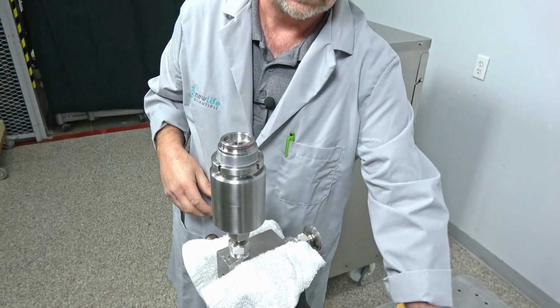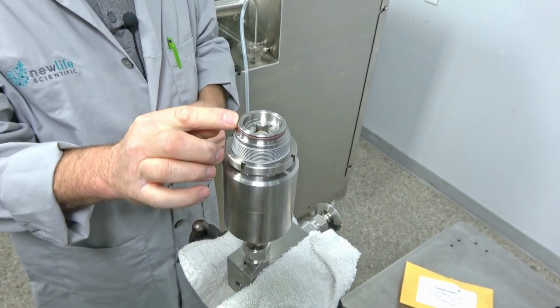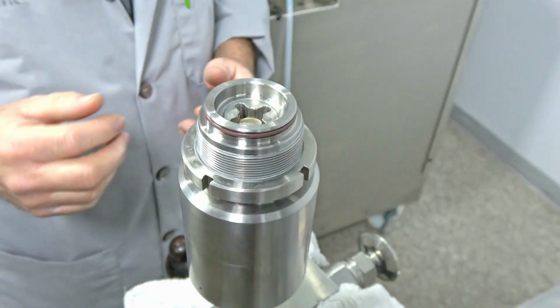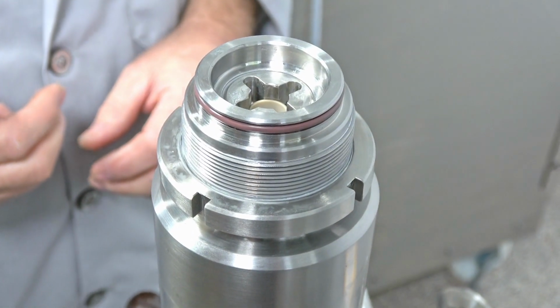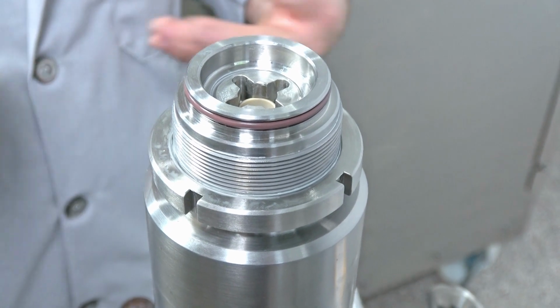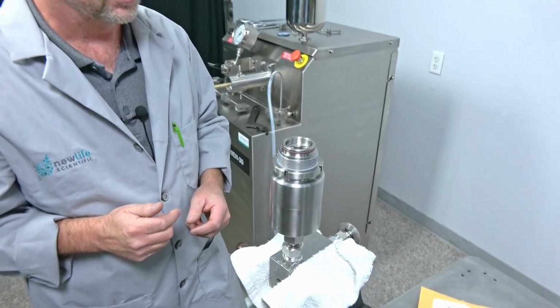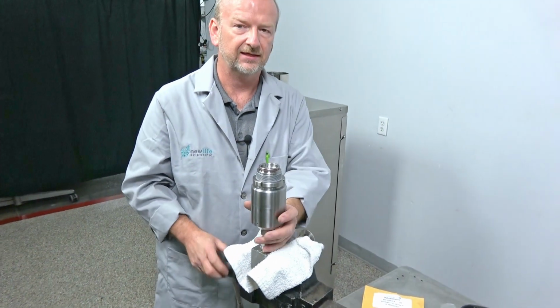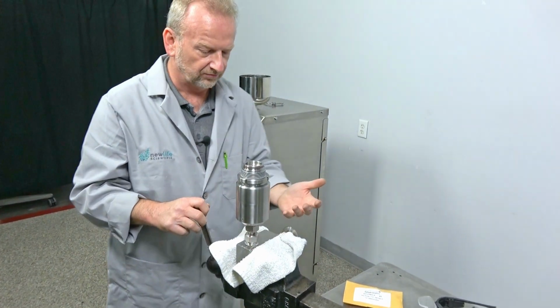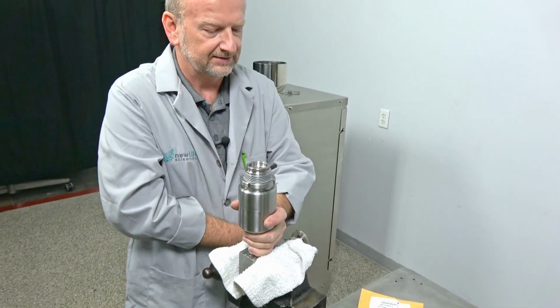So that's about it. This O-ring here just lasts so long. There's really no need to change that outside of a yearly maintenance. But that inner plunger seal, you're probably going to have to change that more often.